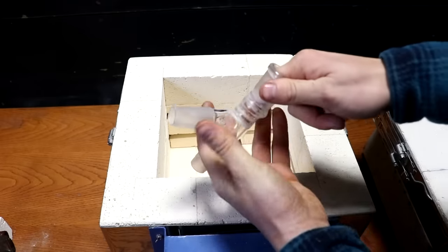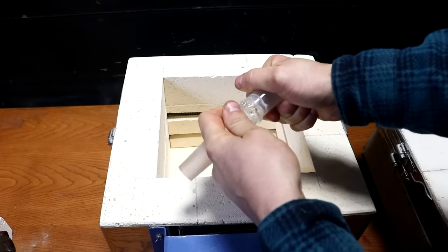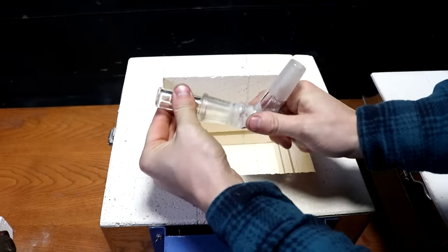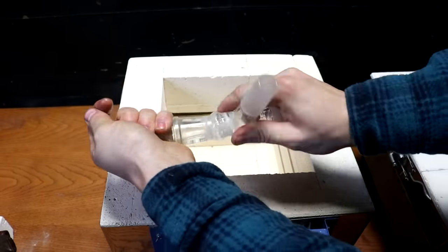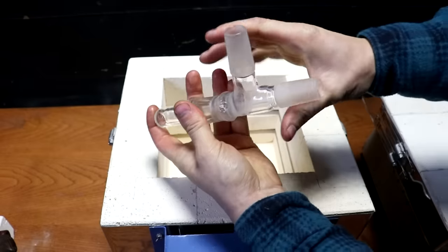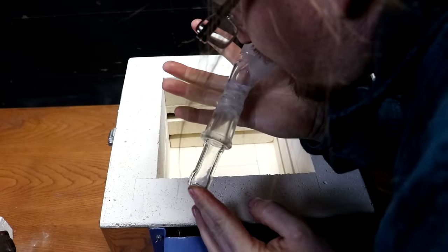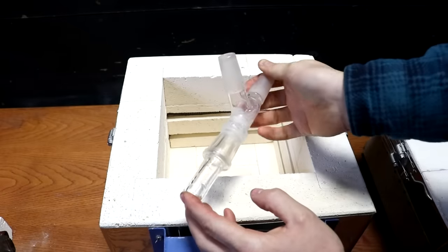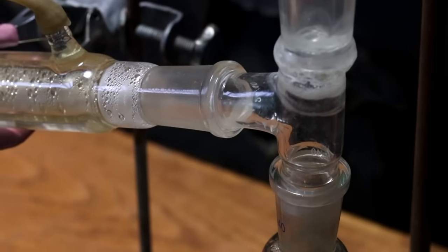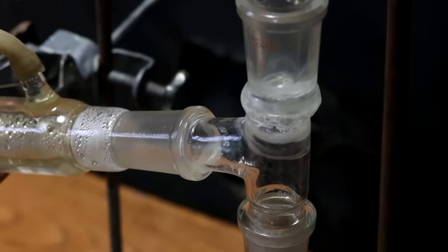Yeah, there's no sharp edge there. Twisting it around, I can't break it with just my hands. Let's see if our plug will fit it. No problem. It looks like that'll be vacuum tight too. Let's see if I can blow air into it and it'll hold. Yeah, no leaks. I think that's good. Might not use it for something that's mission critical, but for everyday distillations and stuff, that should work just fine.